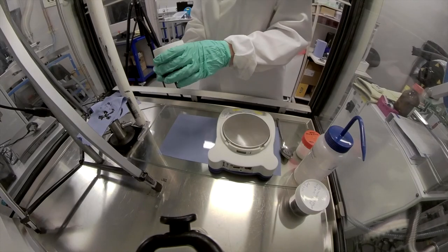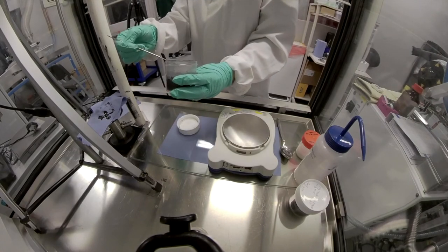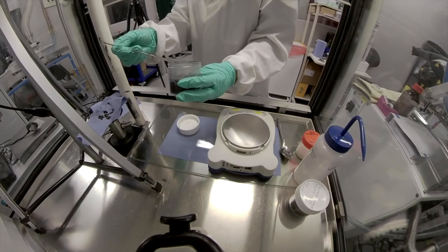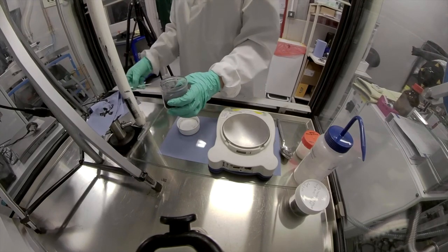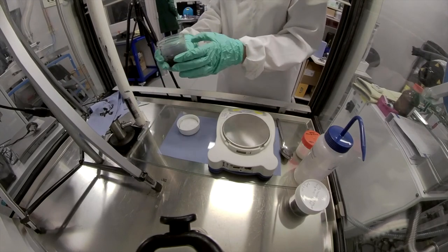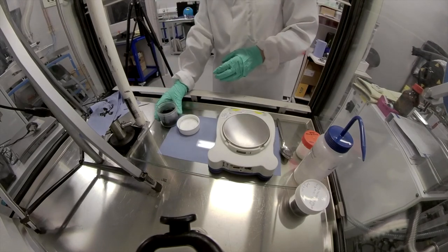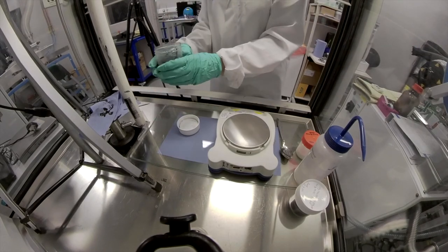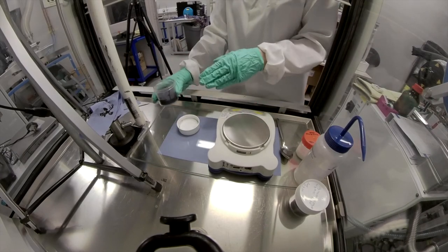Here's what I made a couple of days ago. Now, when I add the SBR, I'll mix it in. But as soon as I stop mixing, it will start to separate out. It does not stay suspended. So after adding my SBR, I'm actually going to prepare my spreading surface before I even start mixing it in.